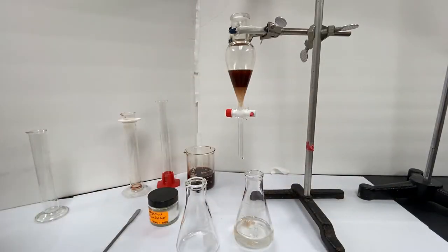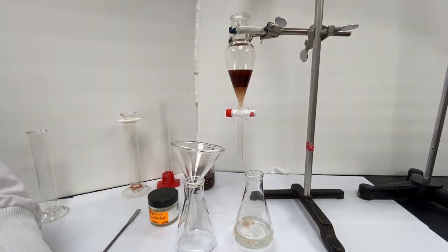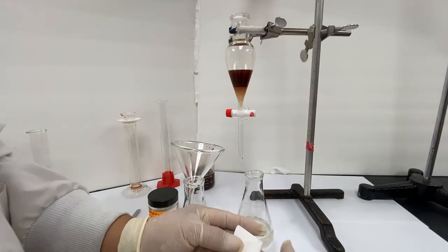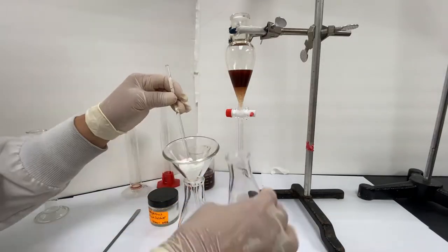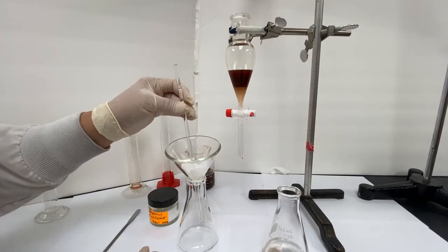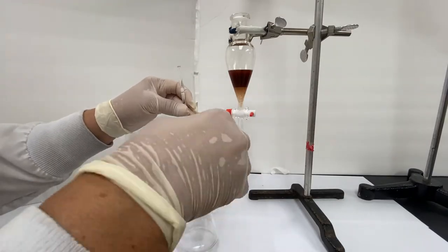Next, you will transfer the dried material to another flask. To do this, standard gravity filtration will be used. Fold the piece of filter paper and slowly pour into the funnel. A glass rod can be used both to hold the filter paper down and to direct the flow into the funnel.